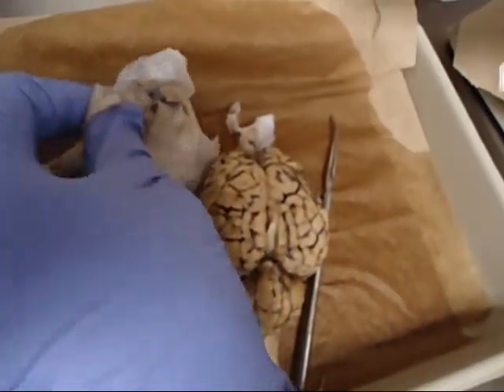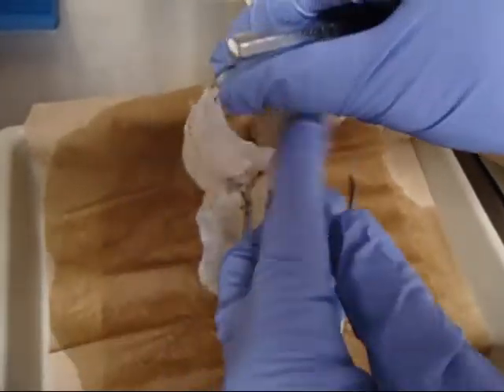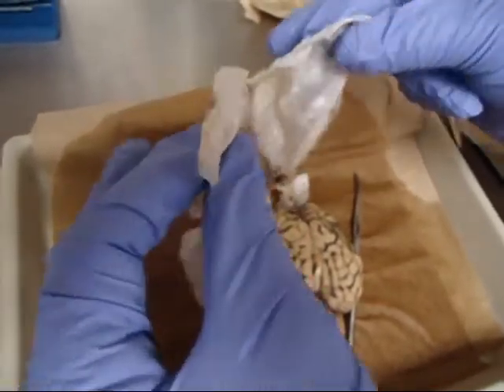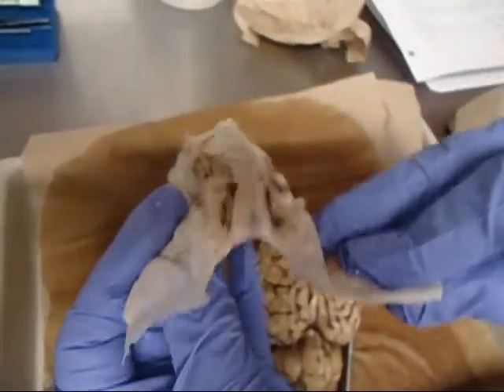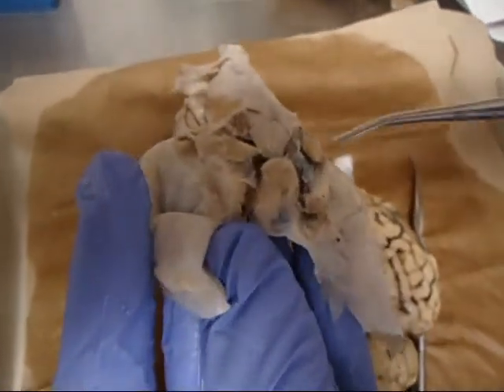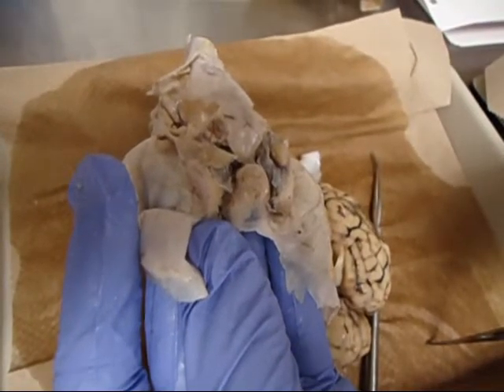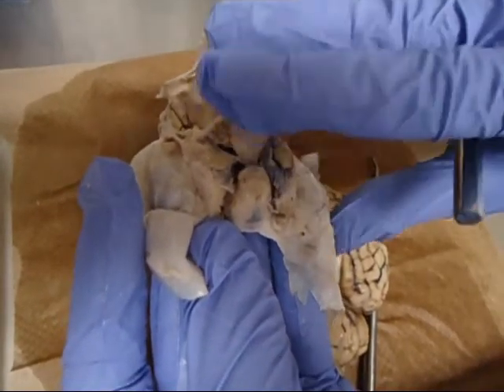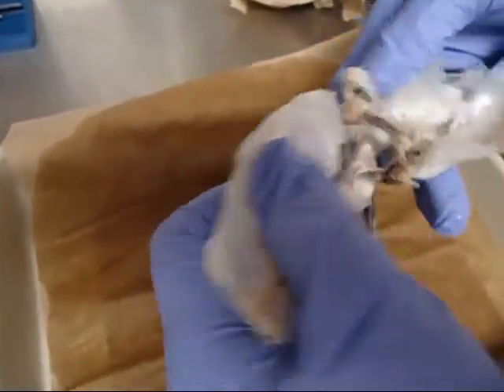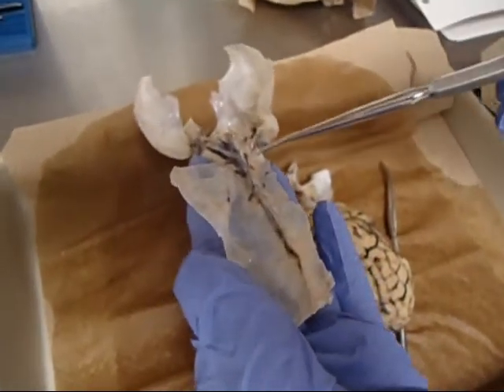The dura mater, which is the hard covering that you remove. The questions he might ask pertaining to the dura mater are to name the lining or the covering. He'll ask you to locate the pituitary gland, which is the tan peanut inside of the dura mater. He may ask you to name the falx cerebri, which is the spiny part of the dura mater that runs inside the longitudinal fissure, which is this part right here.